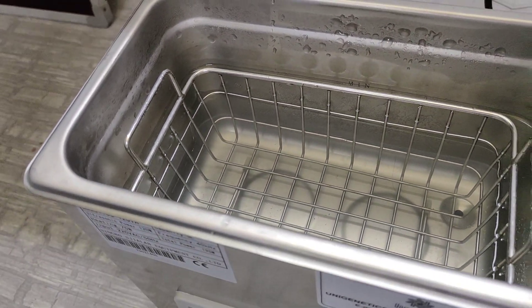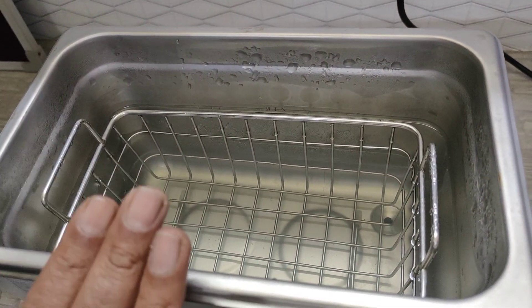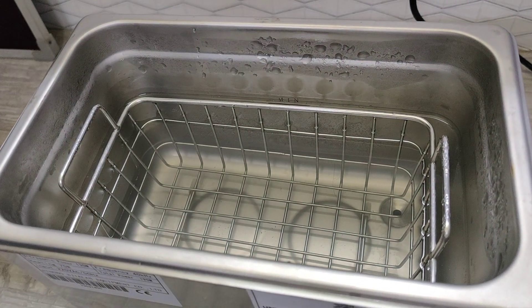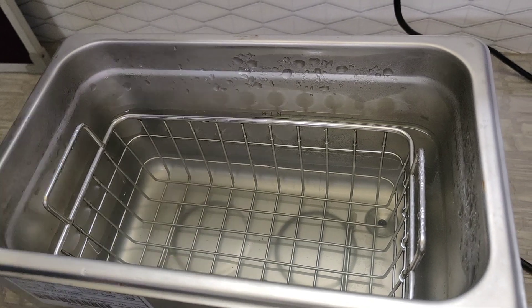A second important point is that we should never run the machine without load — without load means if the tank is empty. We should always fill the tank with the cleaning solution first, and only then run the machine.